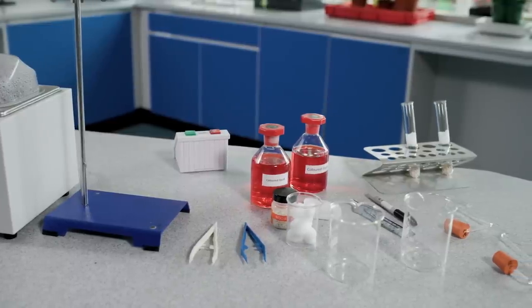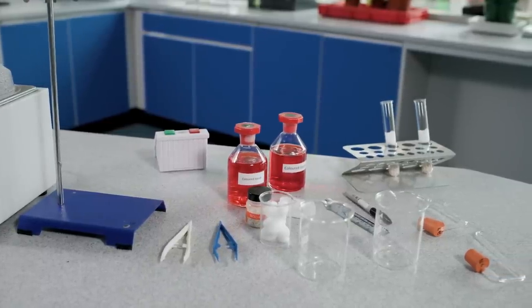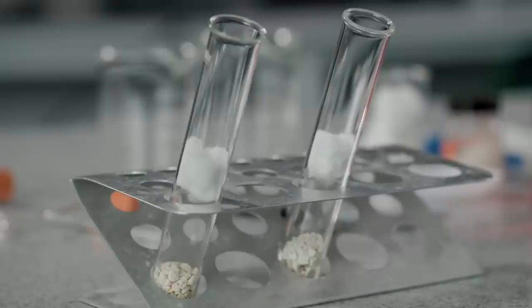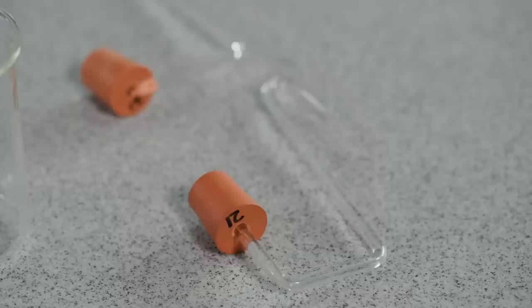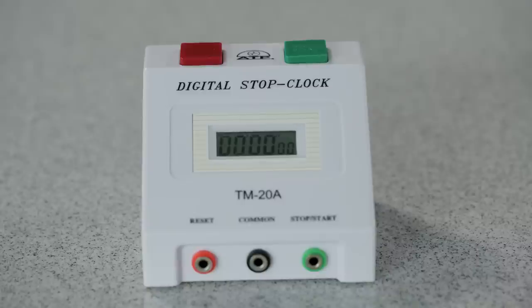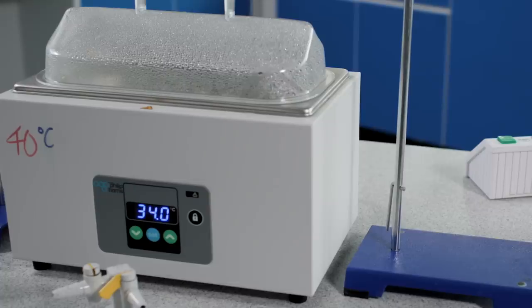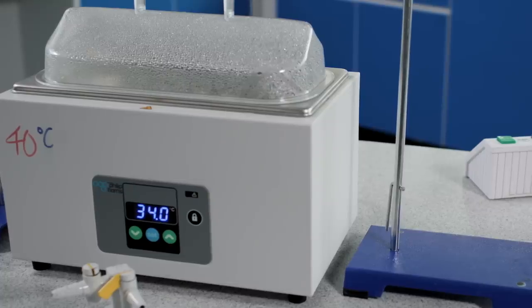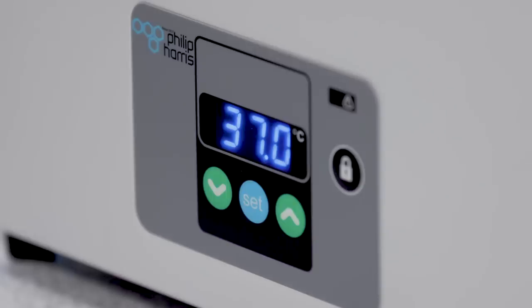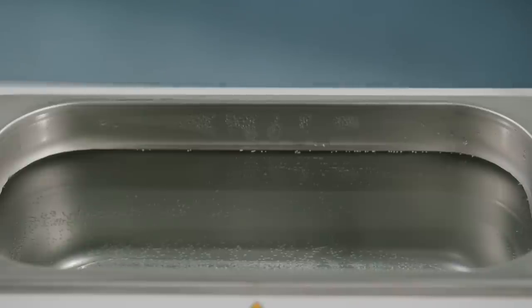To carry out this experiment you will need the following equipment: boiling tube containing soda lime and a cotton wool plug, capillary tube and bung, weighing boat, stop clock, water baths at different temperatures, for example 34 Celsius and 37 Celsius, but a maximum 40 Celsius.